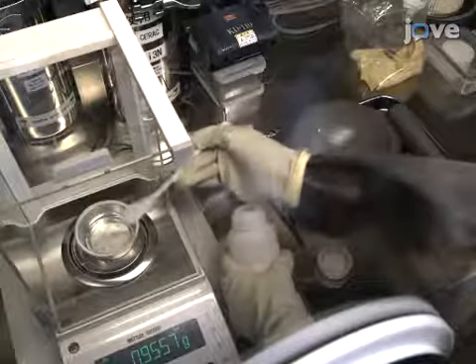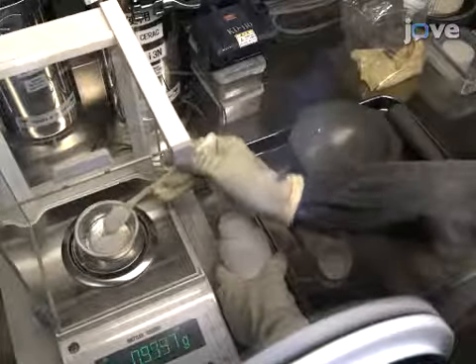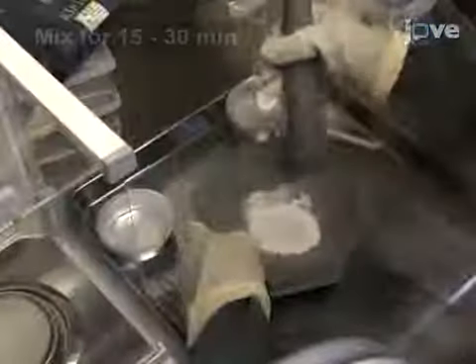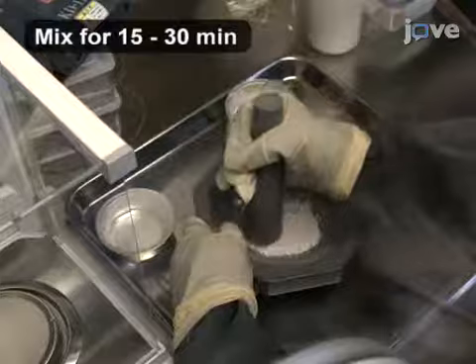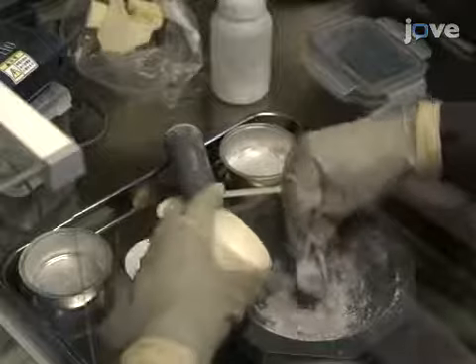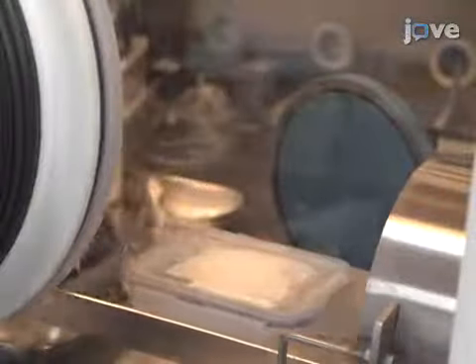Under a low oxygen inert atmosphere in a glove box, place the appropriate initial amount of powders for the desired oxynitride phosphor in an agate mortar. Crush and mix the powders using the agate mortar and pestle until a homogeneous mixture is formed. Pack the mixture into a boron nitride crucible. Seal the crucible in a plastic container and remove the crucible from the glove box.